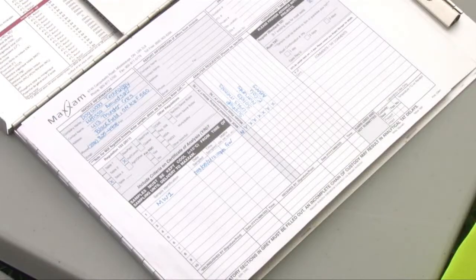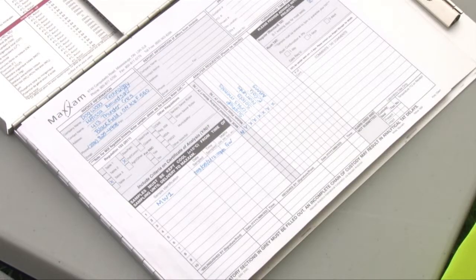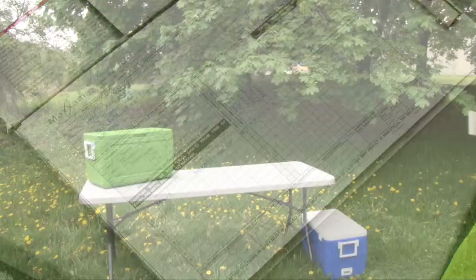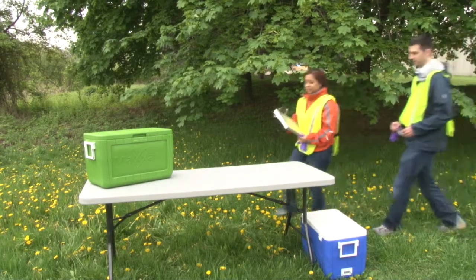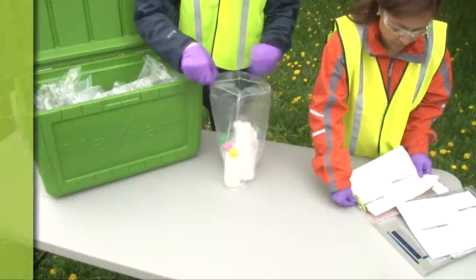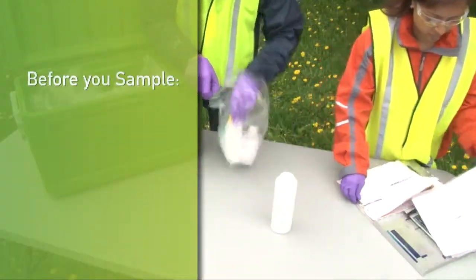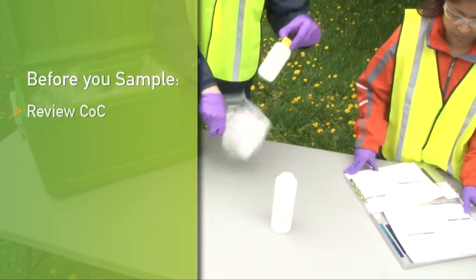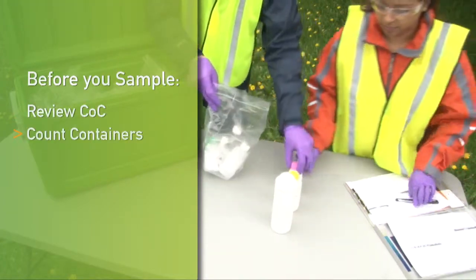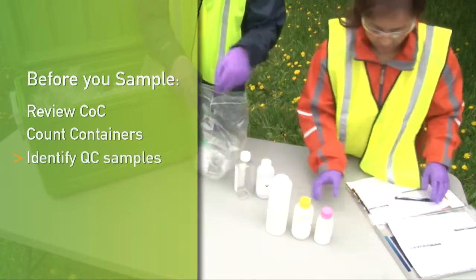Before you head into the field, you will ideally review the COC for the project and fill in whatever information you can. Take a moment to ensure you have exactly what you need. When you arrive at the field location, please prepare a clean, flat work area where you can safely unpack your bottle order. Make sure to count the sample containers and identify any quality control samples that are included in your bottle order.